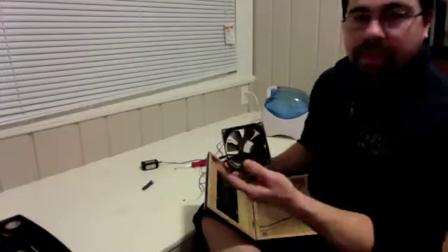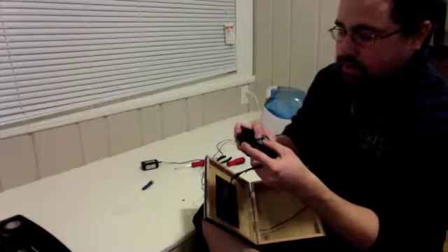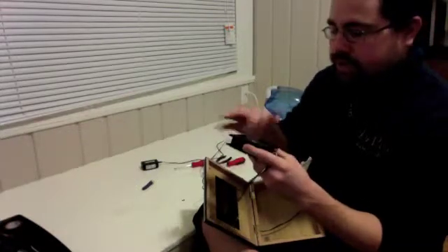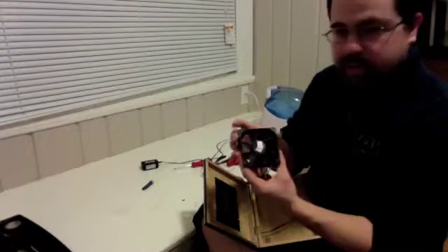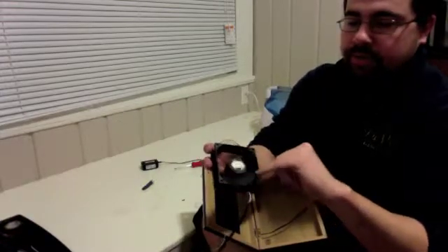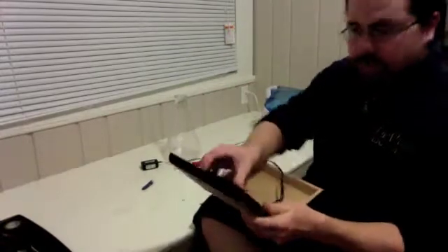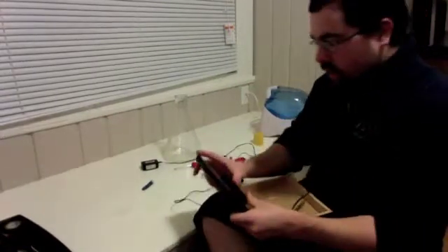And then this, we are going to, first off, get the magnet right on there. Sometimes you'll want it glued in place. This one really doesn't need it because it sits nicely. But you'll want it right on the fan blade so that it spins. And then that's going to go on the upper side, like so. Alright, now we're going to go ahead and get that screwed into place.